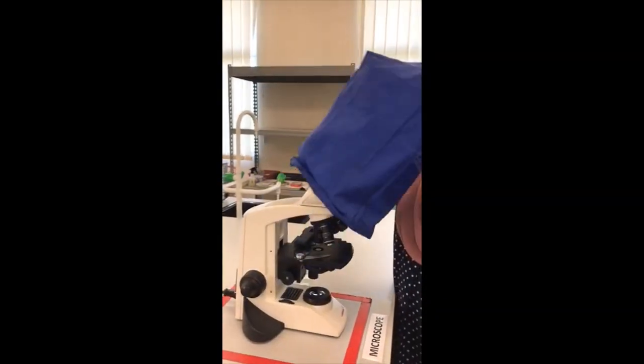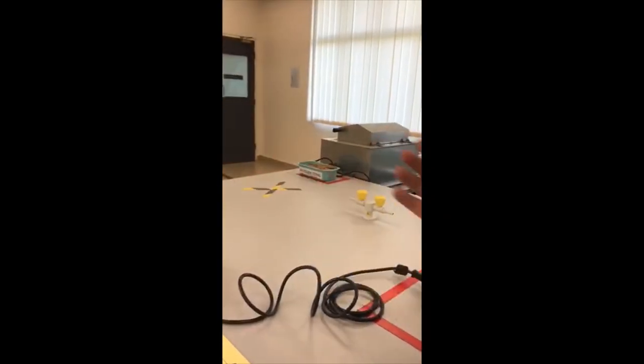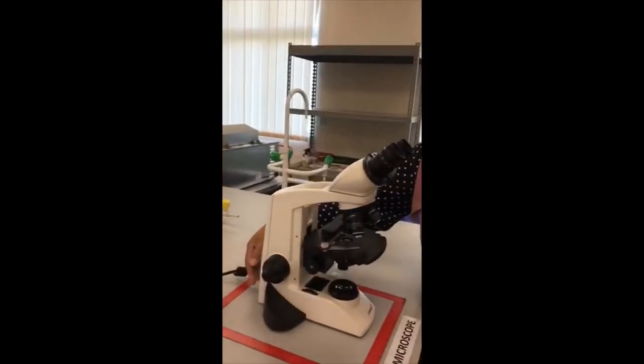I have here in the lab a light microscope that normally will be placed at each bench. I will take out the light microscope cover and put it aside. I make sure that I switch on the power plug and also the switch-on button of the light microscope.